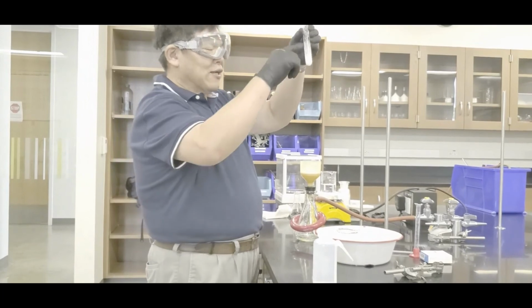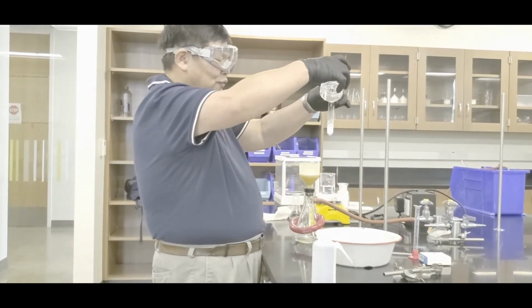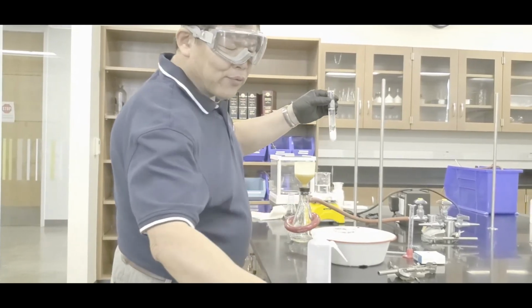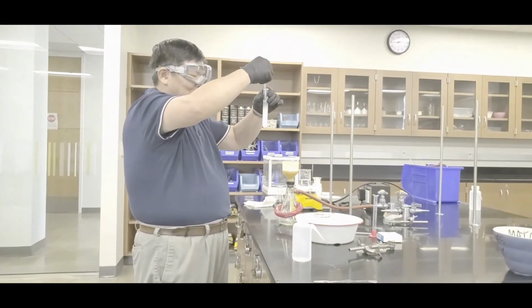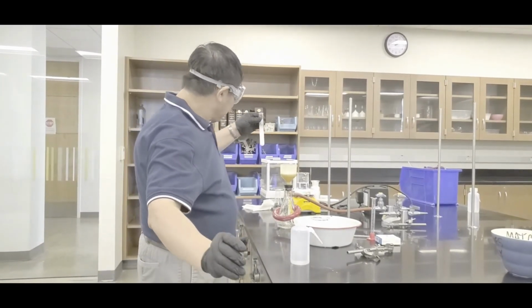Oh, it's stuck. So in that case, what you want to do is fill it about two-thirds with that cold distilled water right there. And then break it up using the stirring rod, yeah? So go, okay? The secret for success is being quick about it, okay? So here we go. Hold it like that, and then what you do is this.